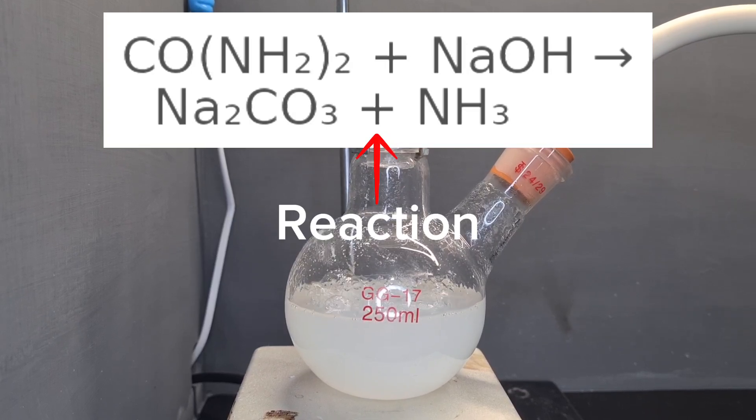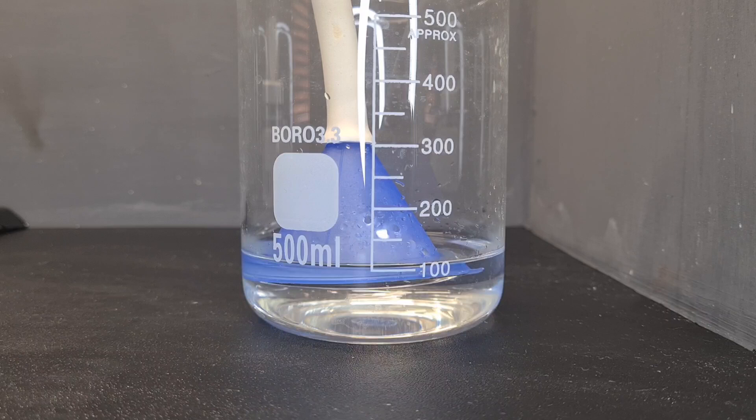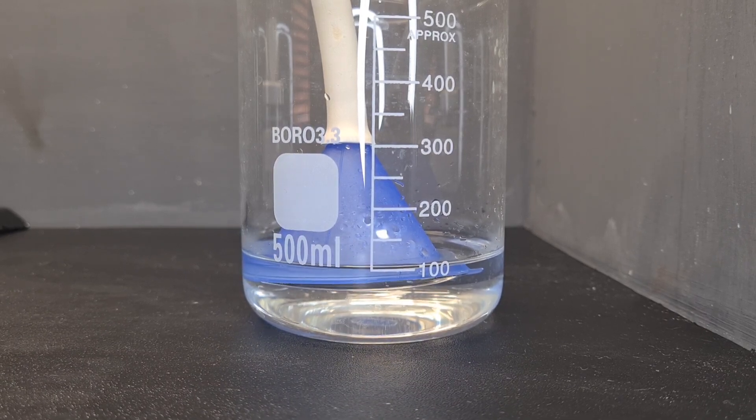Now as the reaction heats up, more and more ammonia will be liberated. And as you can see, when all the air is gone the ammonia just starts dissolving.